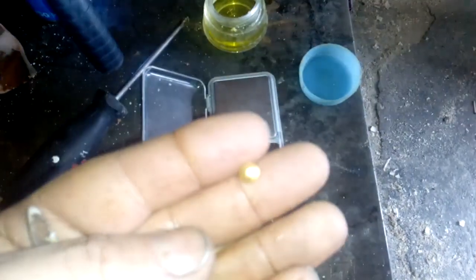I just want to show you — this is gold. Look at that. Very, very nice drop from that finger. We are filtering our golden dust. And this is what we got after melting from our finger straight in aqua regia.